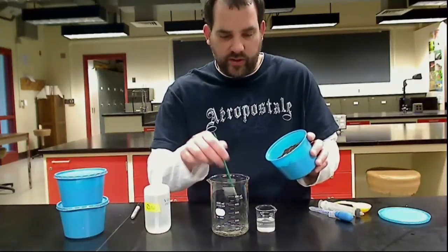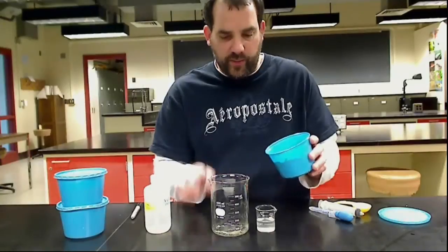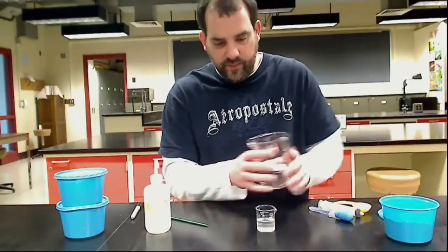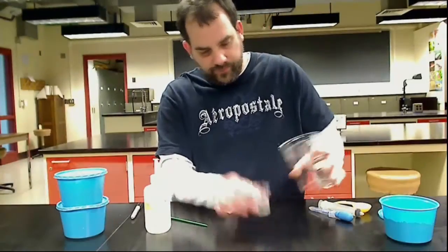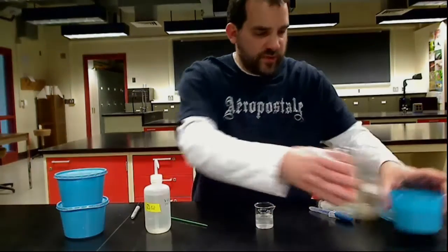Same thing, now rinse it, dunk it into your water, and then you're good to go. So I have my container here full of nematodes. Put this other stuff off to the side.